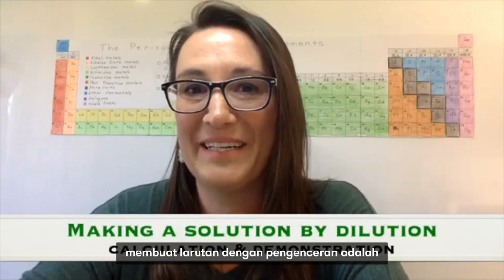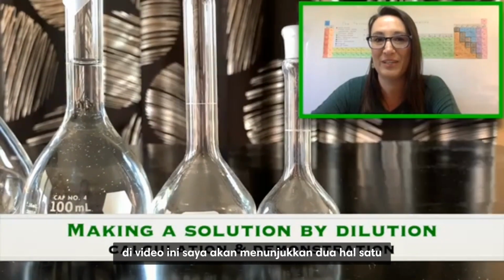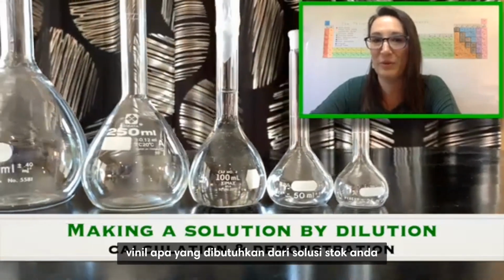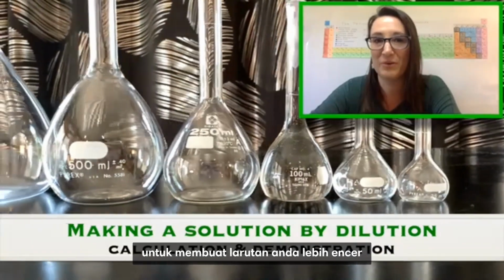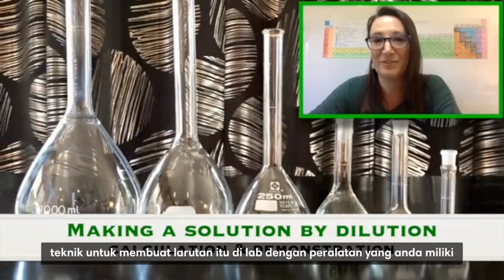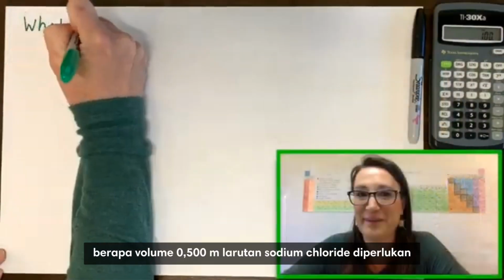Making a solution by dilution is a very common technique in chemistry. In this video, I'm going to show you two things. One, how to do the calculations to calculate what volume will be required of your stock solution to make your more dilute solution. Second, I'm going to show you the techniques to making that solution in lab with the equipment that you have.